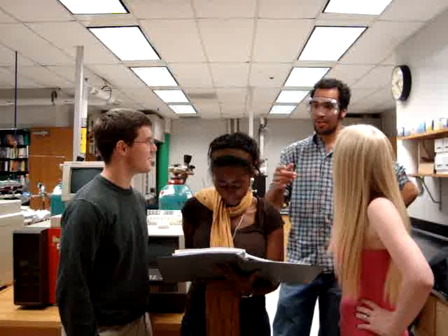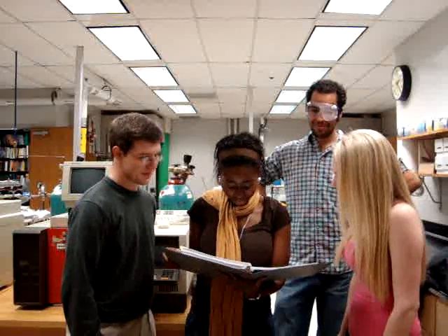Hey, and everybody get your goggles too, remember? Not just, you know, really cool eye protection items too. I guess that's important too. See, I think you guys have a good idea. I mean, the lab isn't boring for boring's sake. It's all about safety.